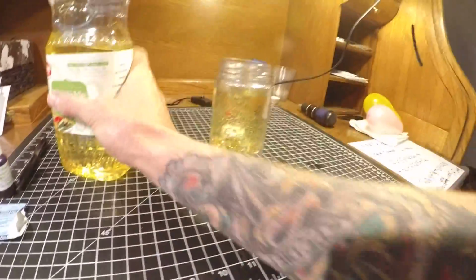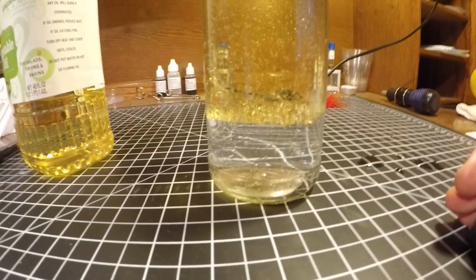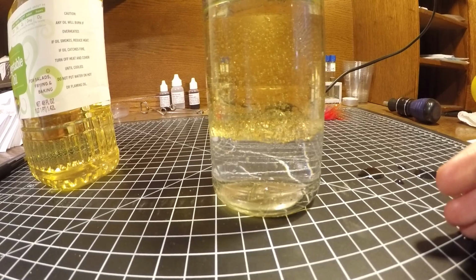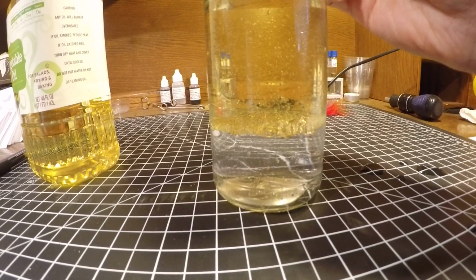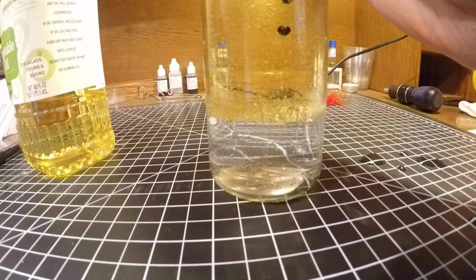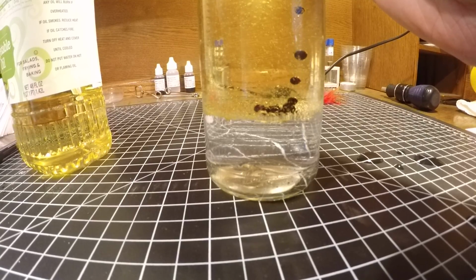These materials obviously don't bind together. Water separates into these little bubbles. After they've been given some time, it'll be more uniform, as some of the water molecules are still sitting inside of the oil. I'm going to go ahead and add our dye, and you'll see them do the same thing as what water would do. They just kind of float as these little dye balls down to the bottom.